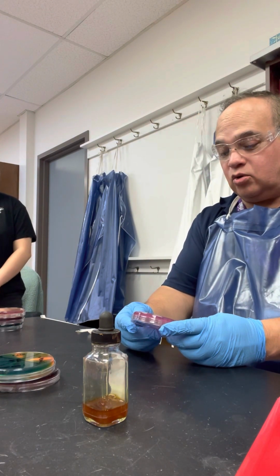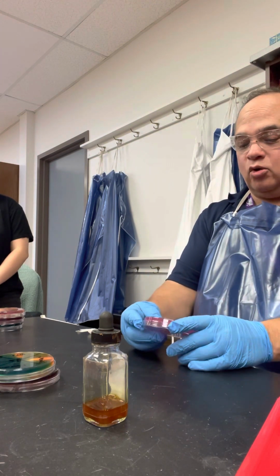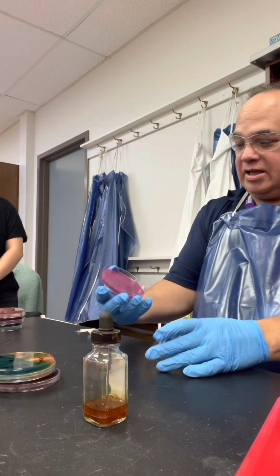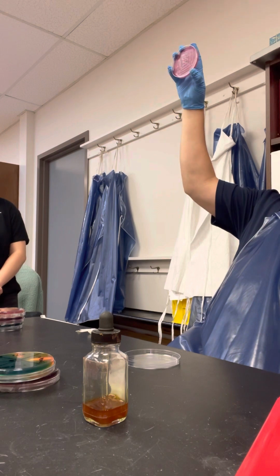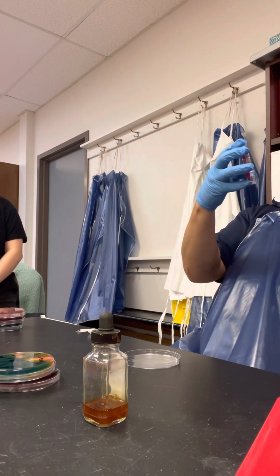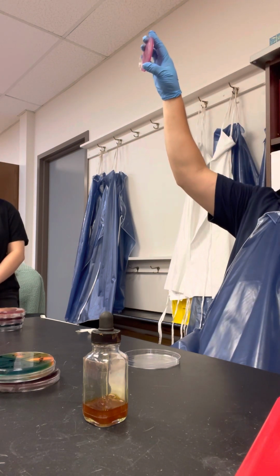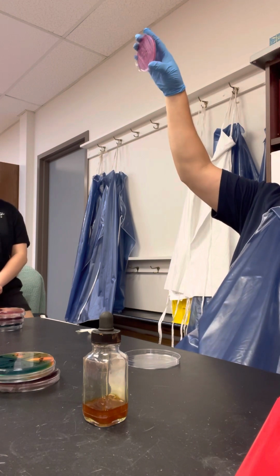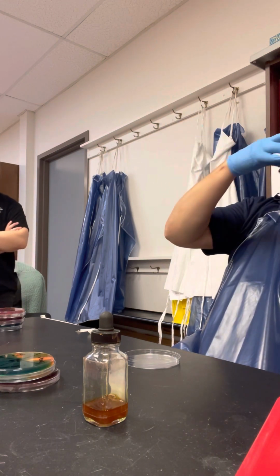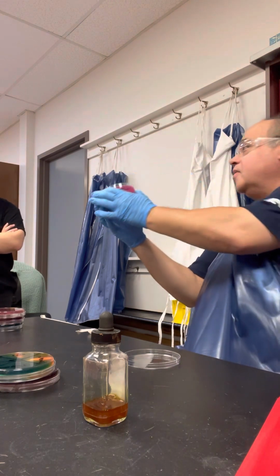Okay. So here is a plate that somebody did for the whole class, but didn't say who. What does it say on the front of it? CS. Who's CS? Chantel. Is it you? Yes, it is. This is absolutely gorgeous. Look at it. But ours was green, because remember it was the E. coli. Well, this one says CS on it, right there. I thought it was originally green. No, here it is. Look at how beautiful it is. I didn't change it. It doesn't change color on this. Don't be making up new science, okay? But you can tell, and to me, if you take a smell, it smells wonderful.